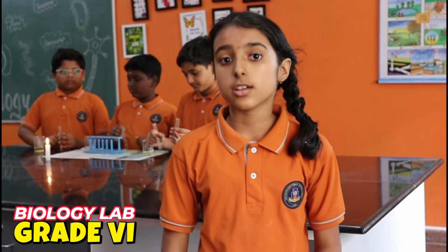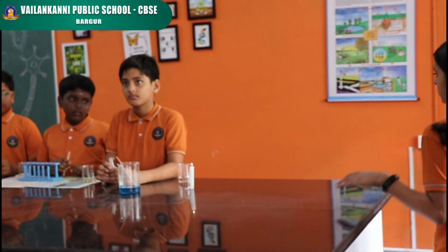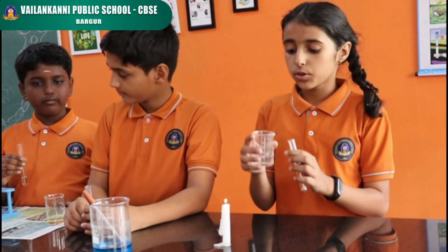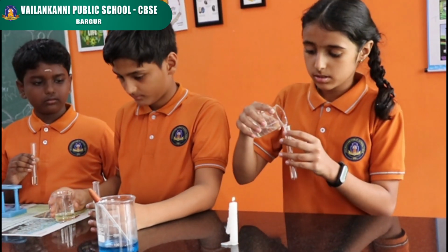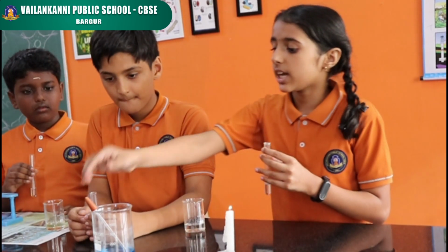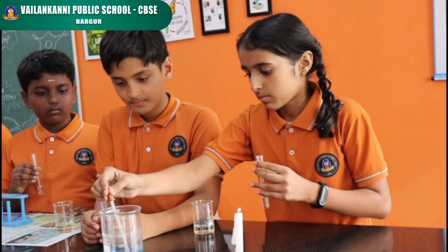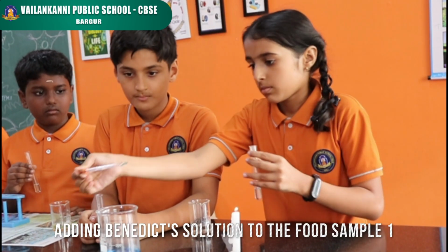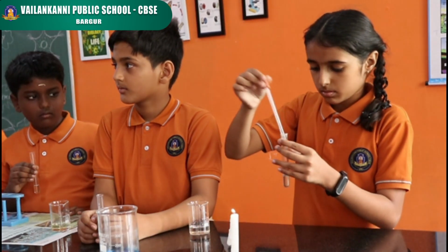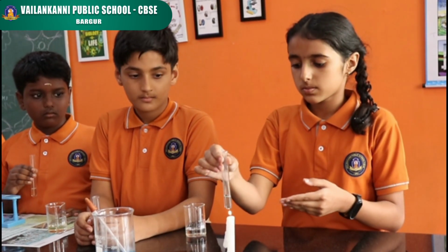Today we are going to test the sugar in the food sample. Let's do the activity. First we will take a few drops of the food sample. After that we will take some drops of Benedict solution. Now we are going to boil for a minute.